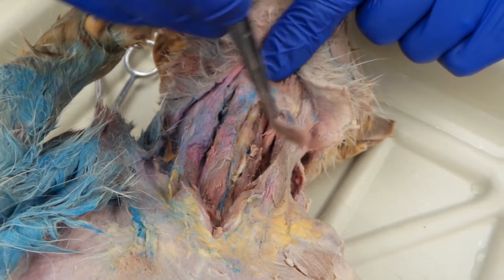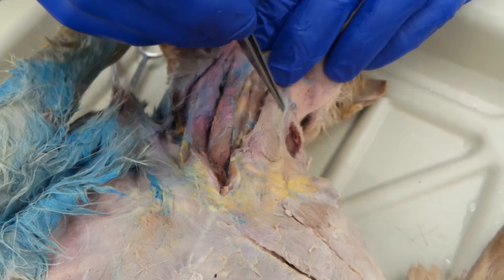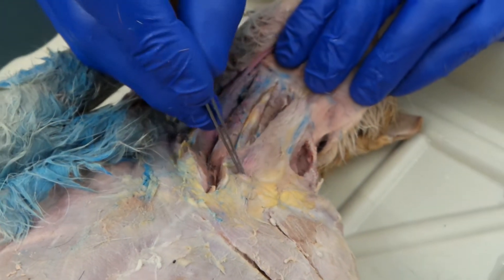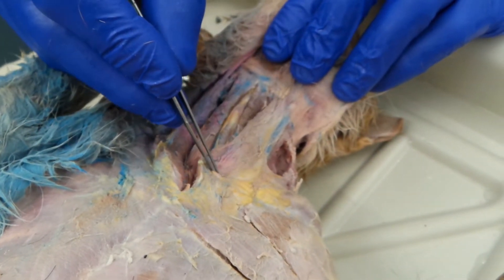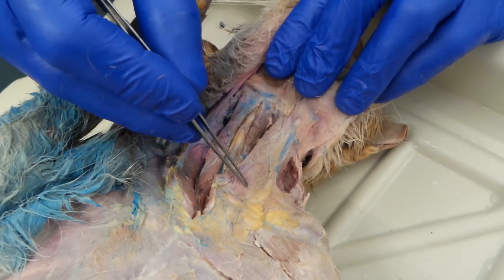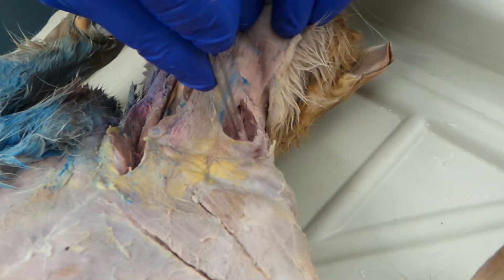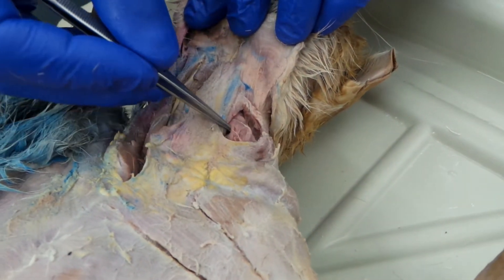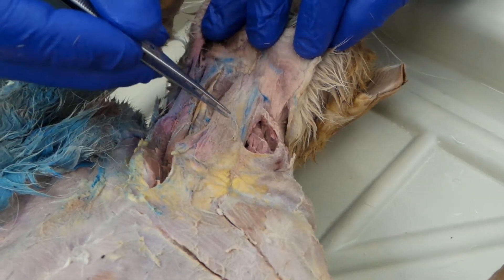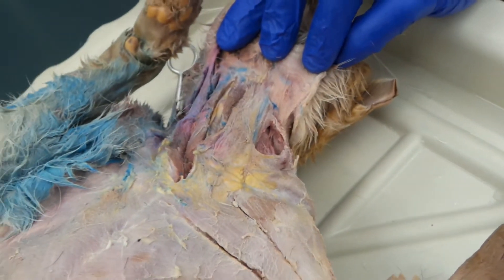I'm going to pull this sternohyoid back down. Now, running right here, with the jugular vein running on it — in cat, it's two separate muscles. In humans, we have the sternomastoid. In humans, this is fused with this muscle right here, the clidomastoid. So in humans, it's the sternocleidomastoid. In cats, it's the sternomastoid and the clidomastoid.